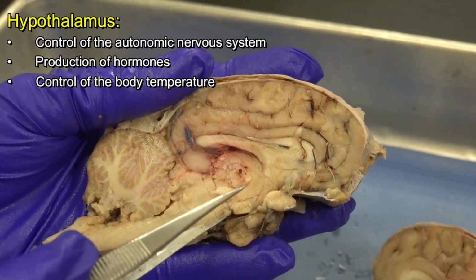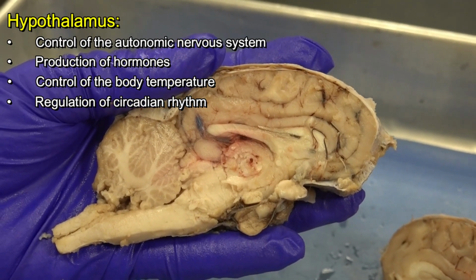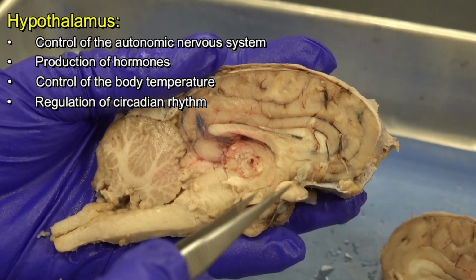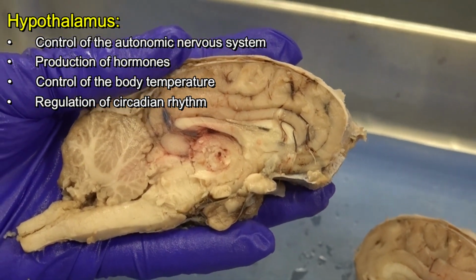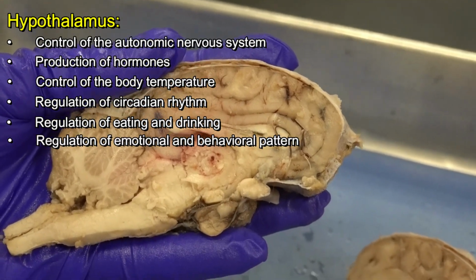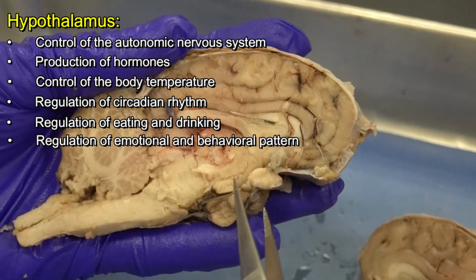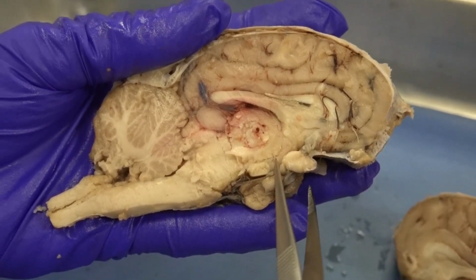This is our biological clock. So one of the reasons that humans sleep when it's dark and wake up when there is light is because of the activity of the hypothalamus. Also, the hypothalamus contains the neurons that control our eating and drinking. So there is a very long list of functions that this very small section of the brain does. So that's about the hypothalamus.